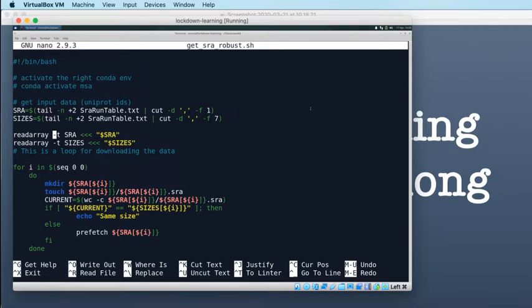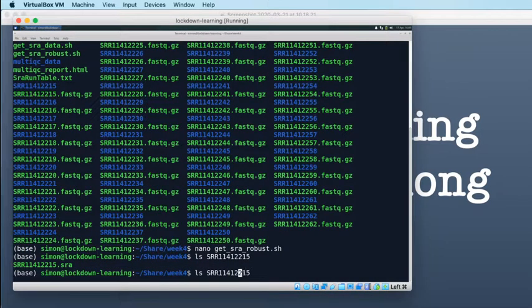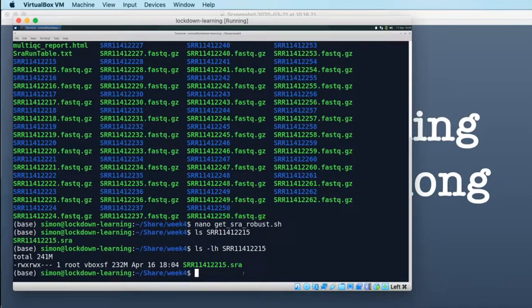So actually, I'll run this and I'll show you. At the moment this is set up just to run for the first file. So I'm getting a sequence of one number, just to let you know what that does. I'm not going to go into too much other detail about this script, but this will run for SRR11412215. So this one here. And if we have a look in the directory for that one, you can see that file is already downloaded, and we can see how big it is. So it's 232 meg. So we've already downloaded that file.